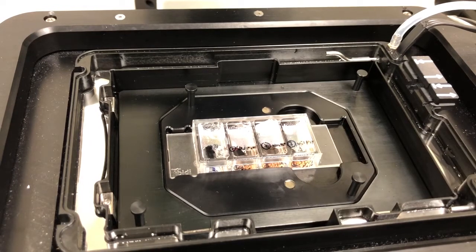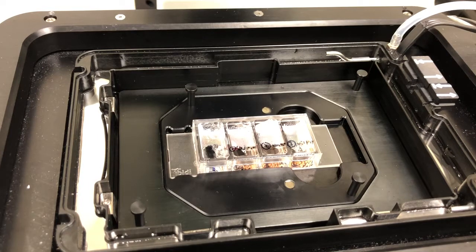As far as keeping the lid on or off, if we were trying to image with DIC we would want to keep that lid off. Since we're not going to do that we can just leave it on and that's fine.